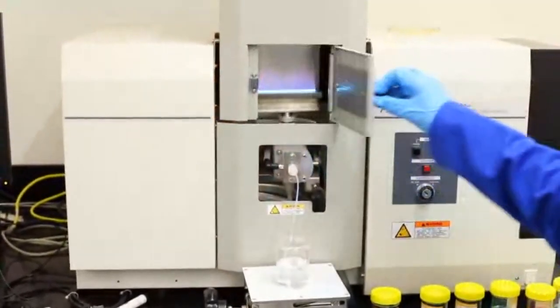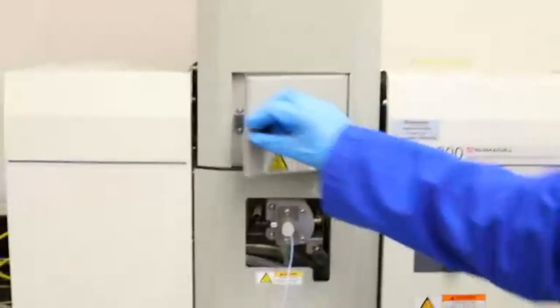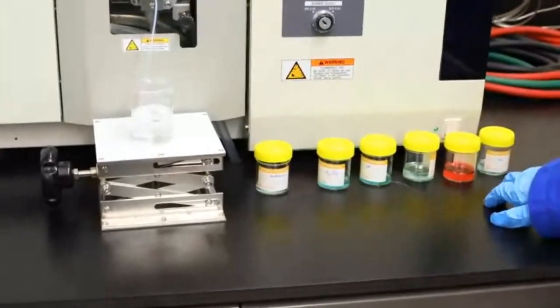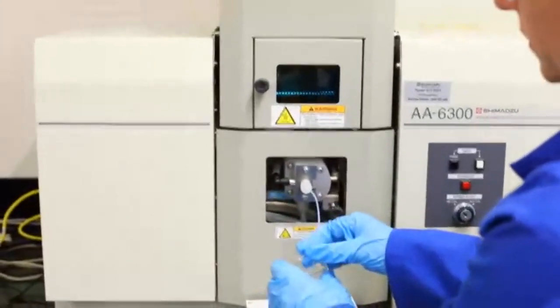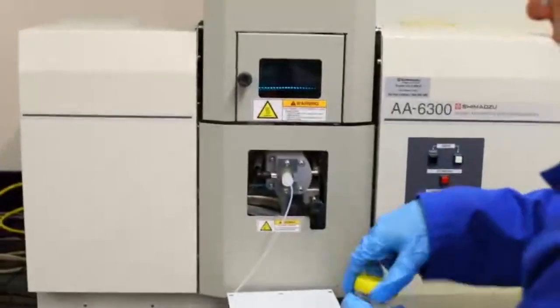Okay, so we're all lit now. What we're going to do is start with our unknown, and then cross-reference it with our knowns. You may see there's a bit of a different colour there, a hint that maybe that's not the right one. We just have distilled water each time because we want to flush out the system.